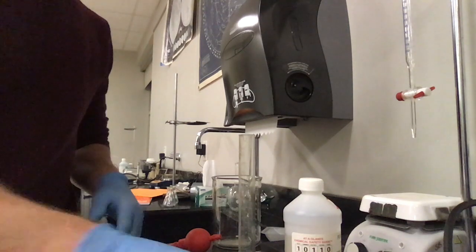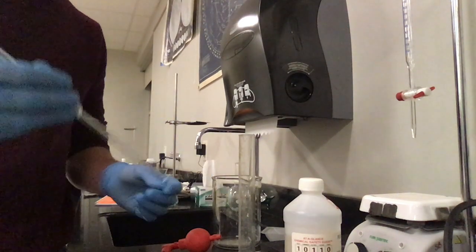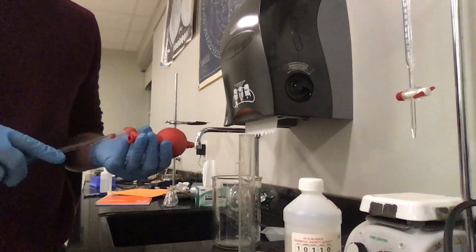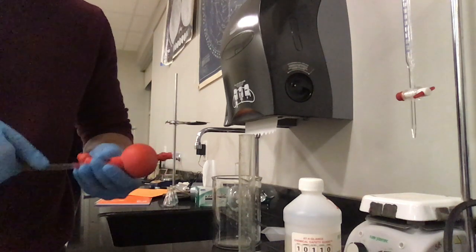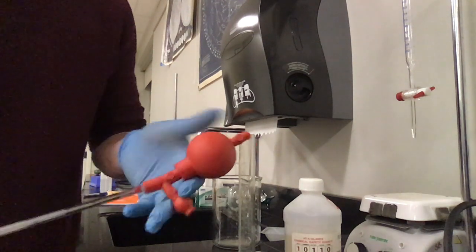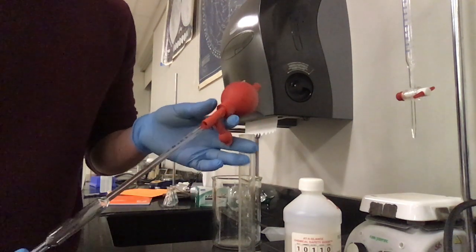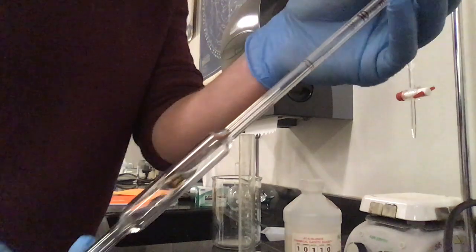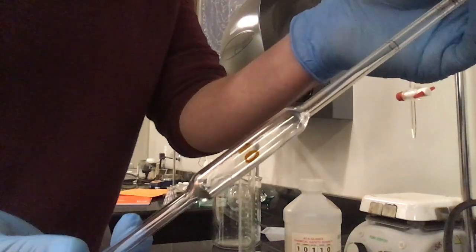Okay, so let's start by getting a very specific amount of this hydrochloric acid of unknown molarity into that Erlenmeyer flask. So I've attached my pipette bulb to my volumetric pipette. This one measures very specifically 10 milliliters.